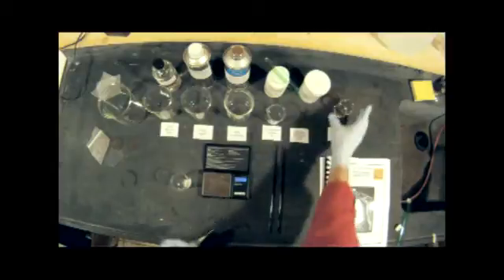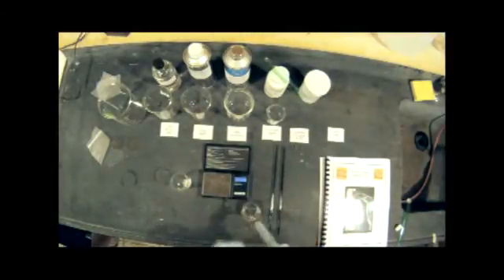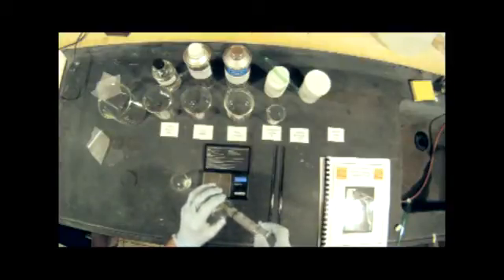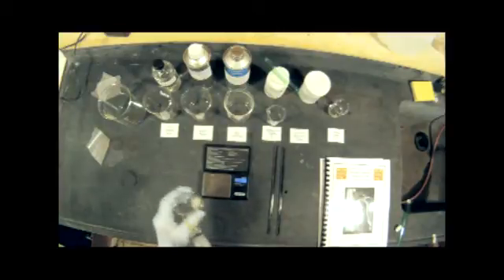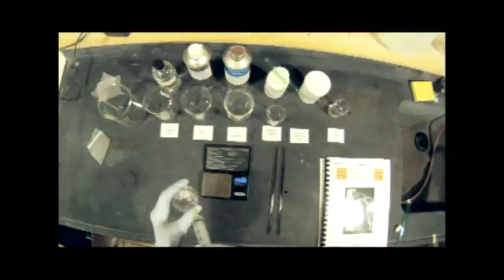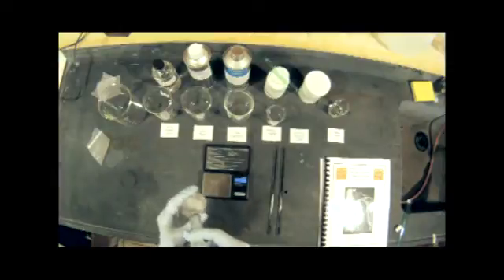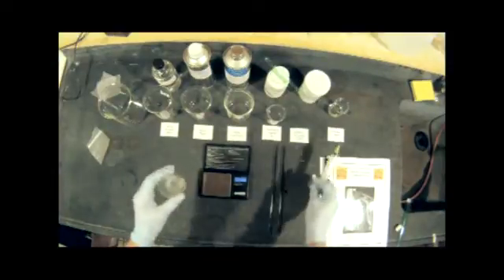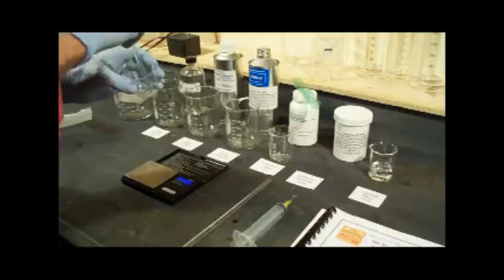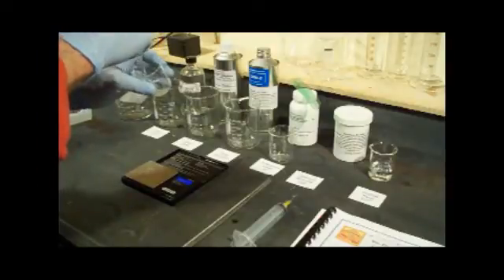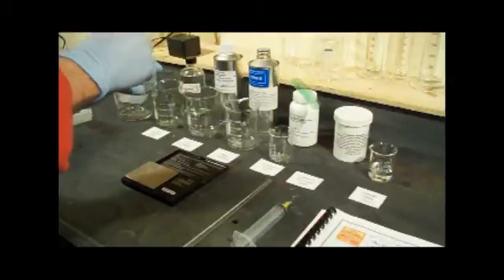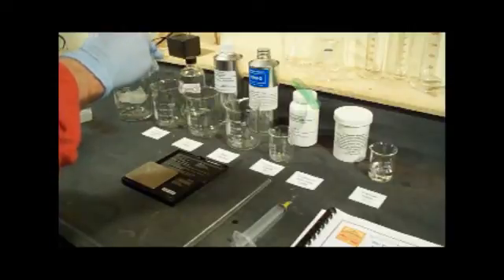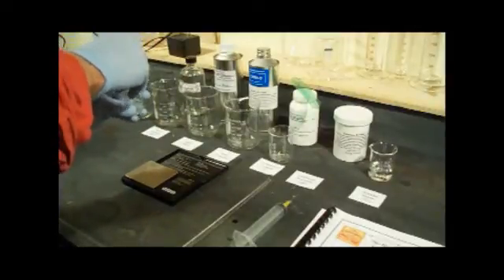To the cadmium bromide we want to add two milliliters of water so I'm going to use a syringe and draw up two milliliters. The cadmium bromide is going to cake up when it gets wet, so I'm going to try and distribute that around the bottom and keep it moving while I put the water in, and that will prevent it from caking quite as much. We want to stir this until all of that cadmium bromide is dissolved. We don't want to have little crystals in chunks because that just won't go into solution later when we put it into the collodion.